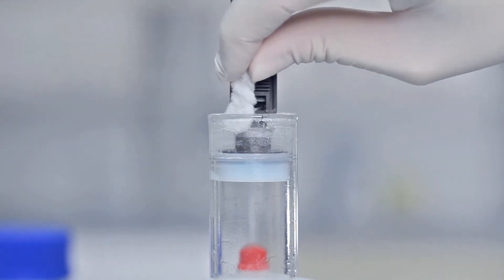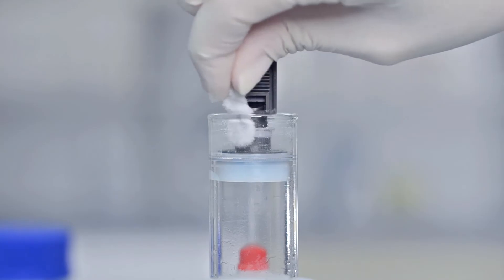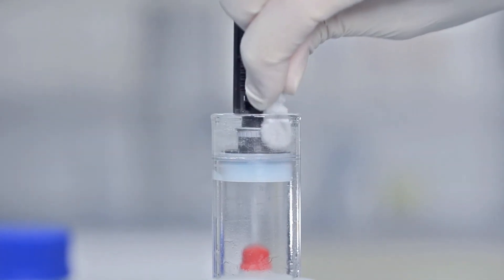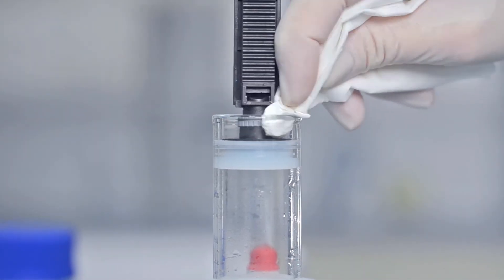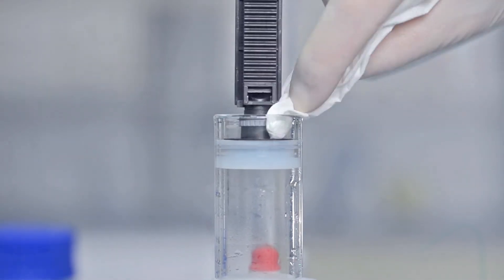Remove any crystal deposits on the dispensing cylinder using water or dilute acetic acid and a soft bottle brush or a bent pipe cleaner. Then dry off using a laboratory wipe.